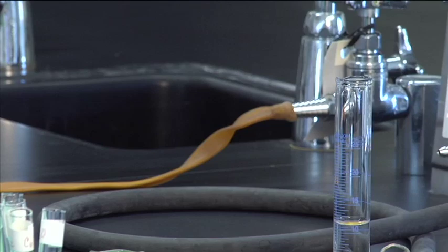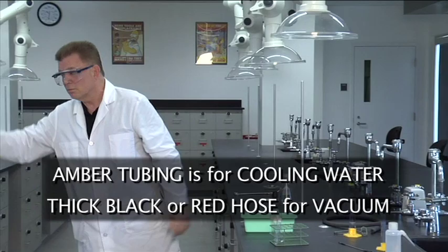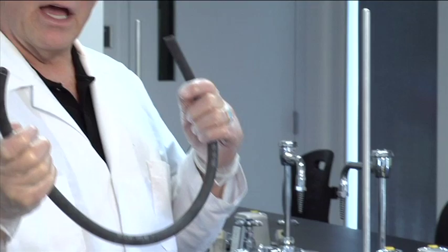So do not use the amber tubing. That's for running cooling water. So this will not work. We've tried that experiment. It doesn't work. Now you want the black hose. Now you have a choice.